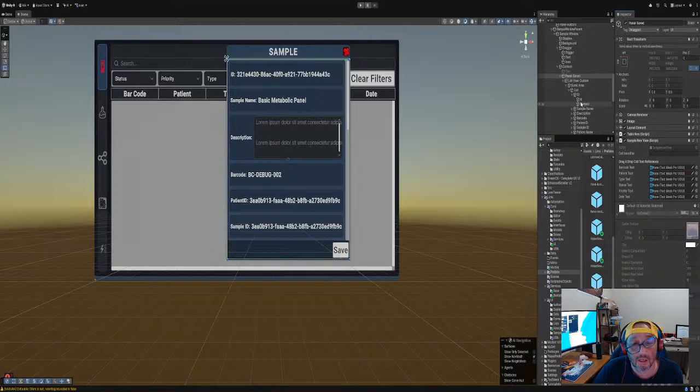So barcode will be right down here. So we go barcode content, right? And then we'll go to patient text, patient name. That's down here, I'll put that here. And then we're gonna say type text, type text. Oh, the actual type. Do I have a type here?